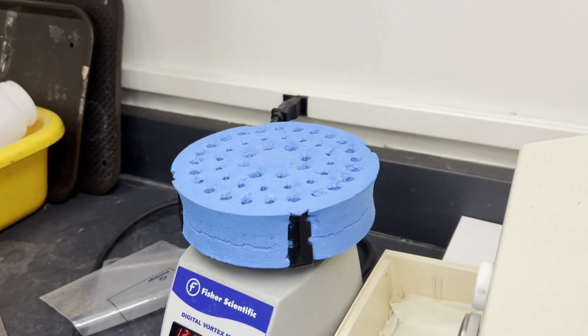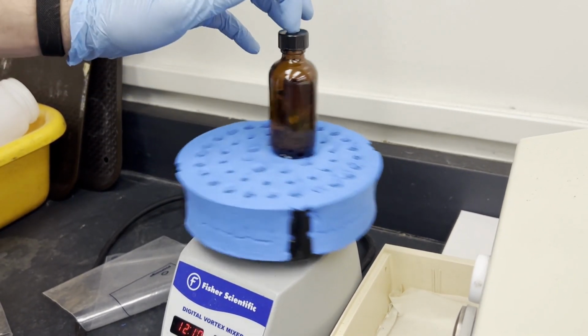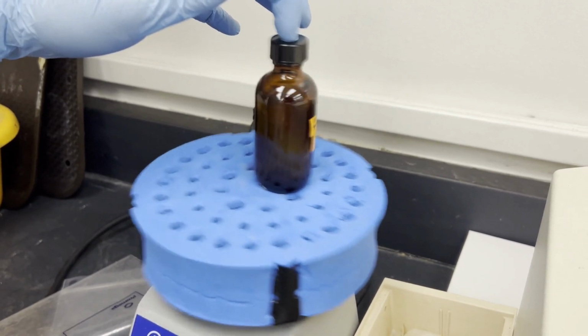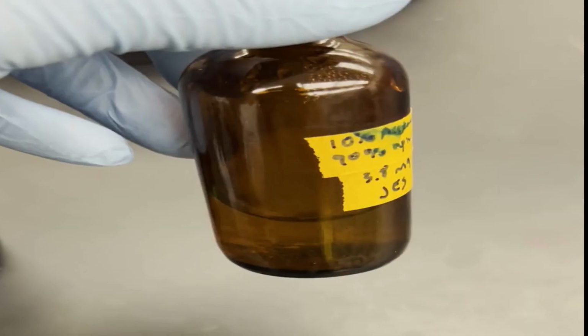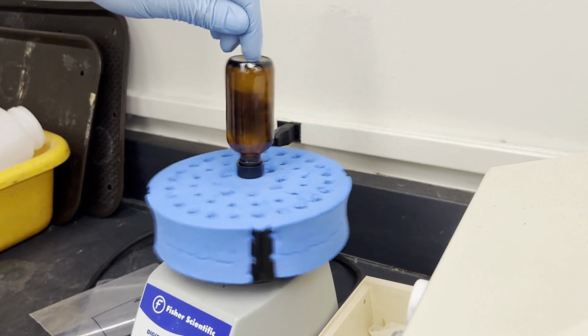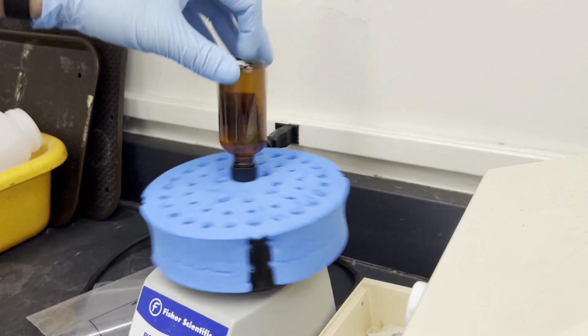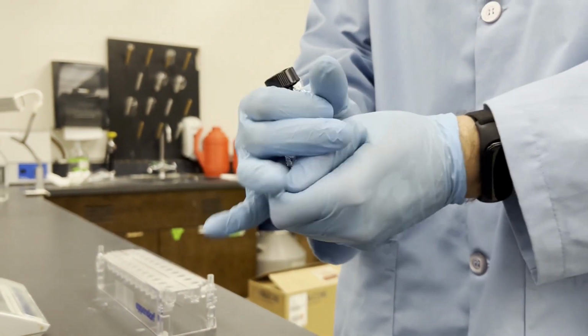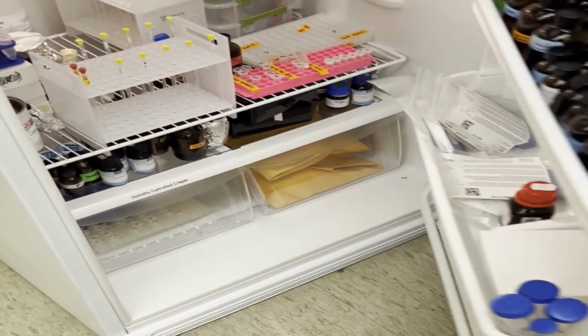It can take some time to get the Marfey's to dissolve, especially if it was very cakey. We don't want undissolved particles in our reagent, so make sure it's mixed well and remixed before use. The reagent is stable, however it will degrade in light. Be sure to cover it to minimize this and store it in the refrigerator until needed.